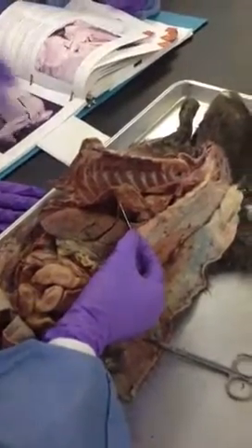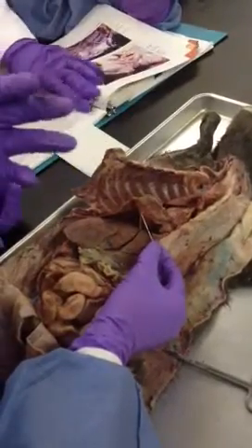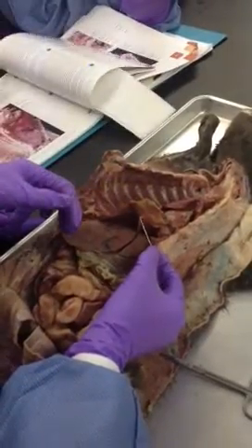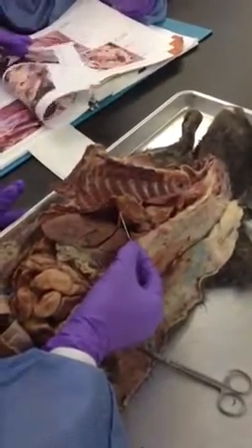Because fetal circulation is different than when you become an adult. And you can have problems if those stay what's called patent or open. All right? So it's the obliterated. Obliterated means the remnant of the umbilical vein.